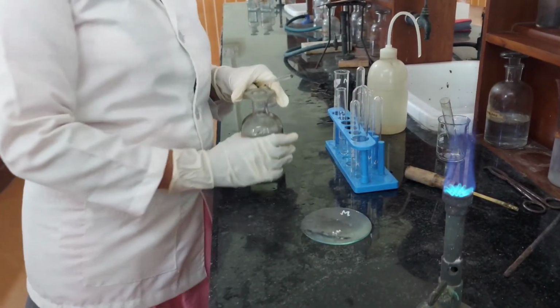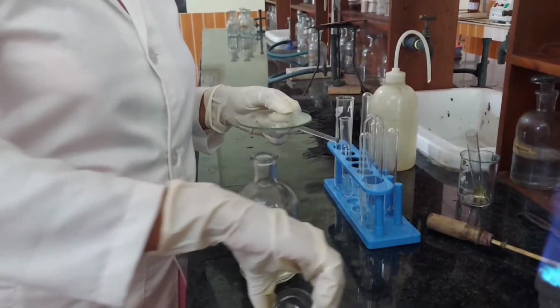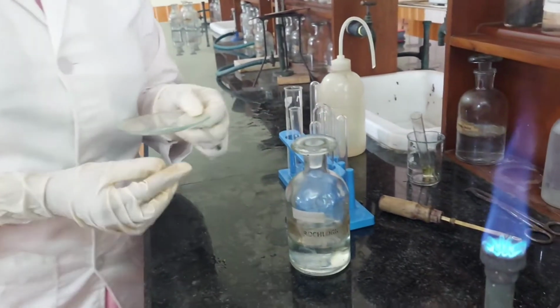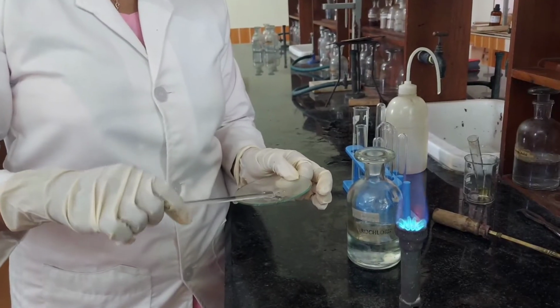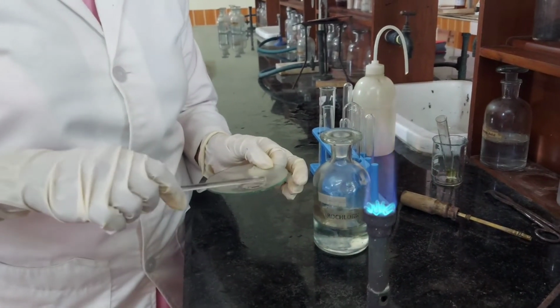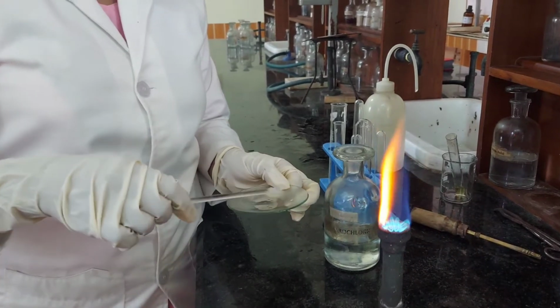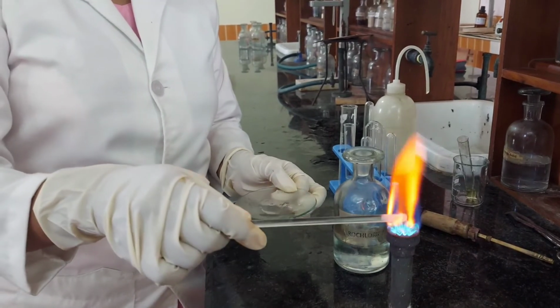To confirm the presence of calcium, flame test is conducted with the above precipitate. For that, the precipitate is mixed with a little concentrated hydrochloric acid and made into a paste. It is shown to the non-luminous flame. As you can see, there is a brick red flame, so the presence of calcium is confirmed. The characteristic color is due to the de-excitation of the thermally excited electrons with emission of visible light.